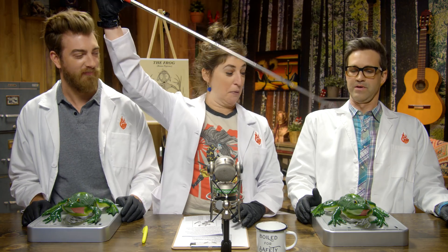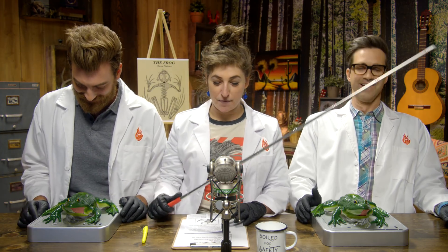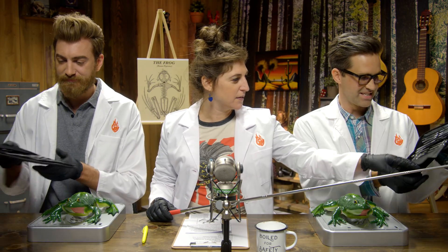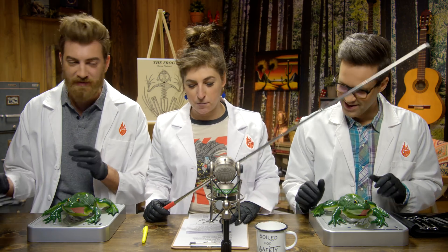What do you have? I have this. Yeah, that's convenient. Are you gonna hit us with that or point things out? No, I'm gonna point things out. Frog and frog. Okay, are we ready to get started? Let's get started. I've got a whole kit here with sharp things. Yes, finally. We'll need super sharp things — Link doesn't know those are all rubber.